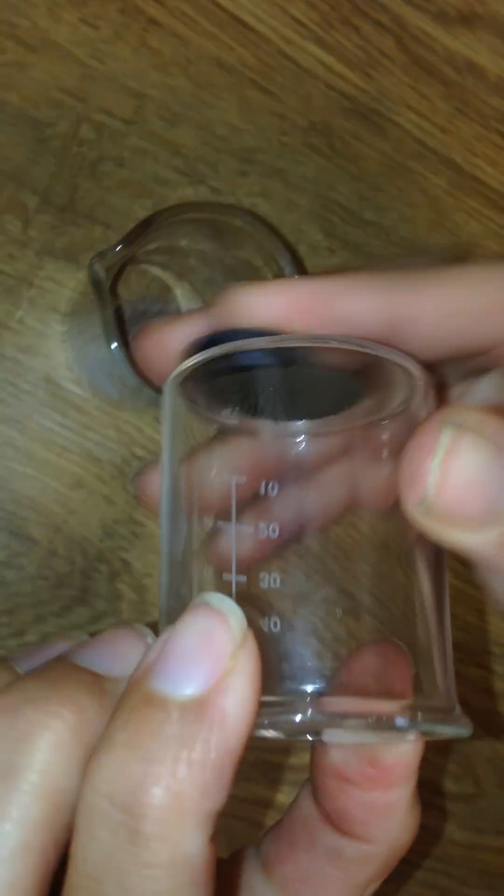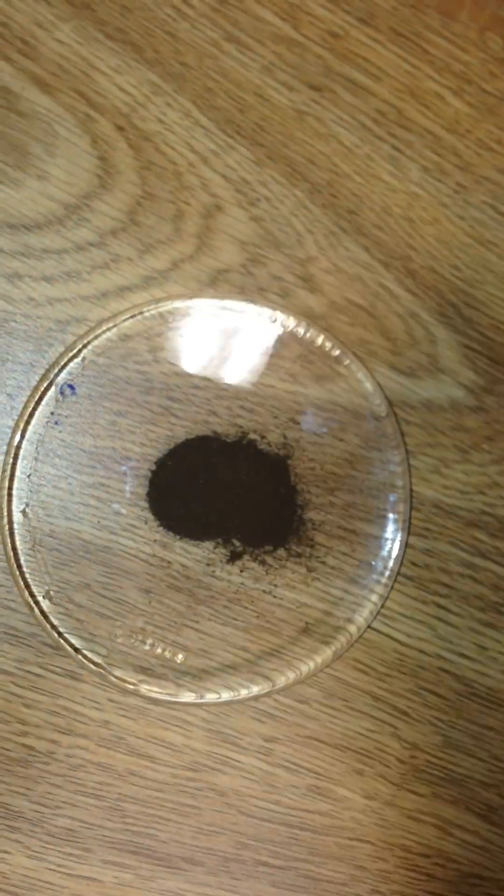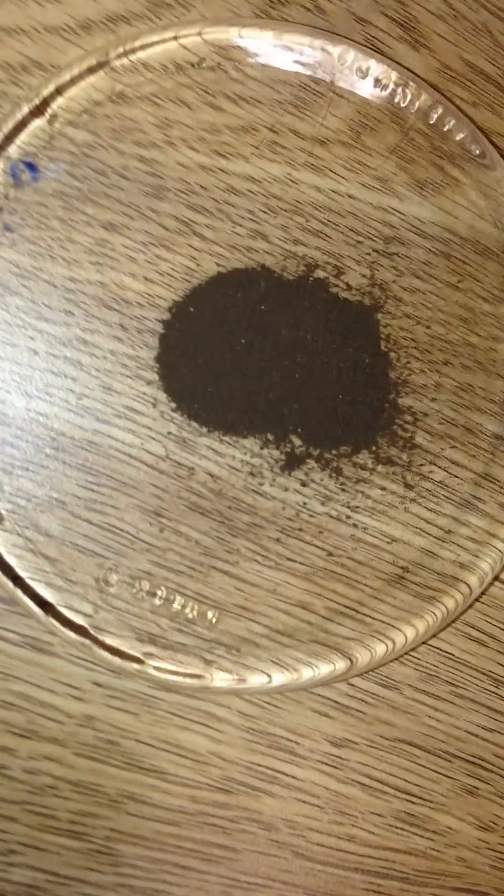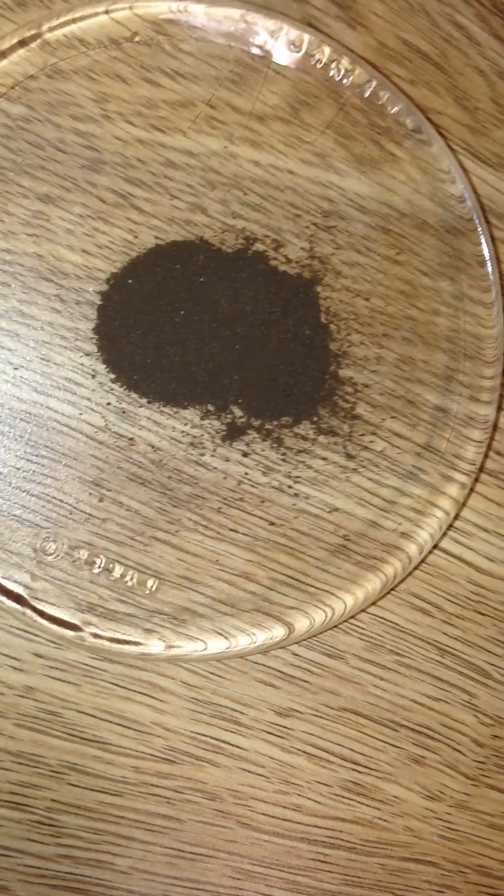Wow. It's just like magic, only it's science. Whoa. Oh my. Ain't that just pretty. Cool.